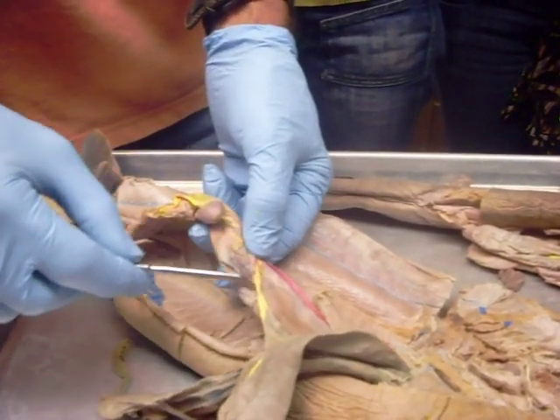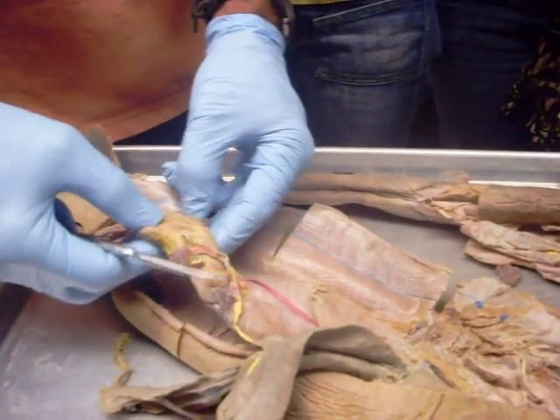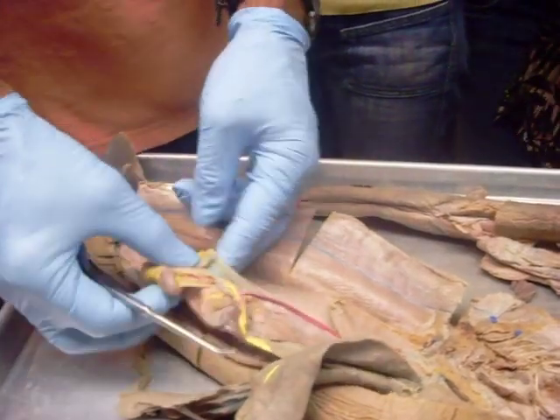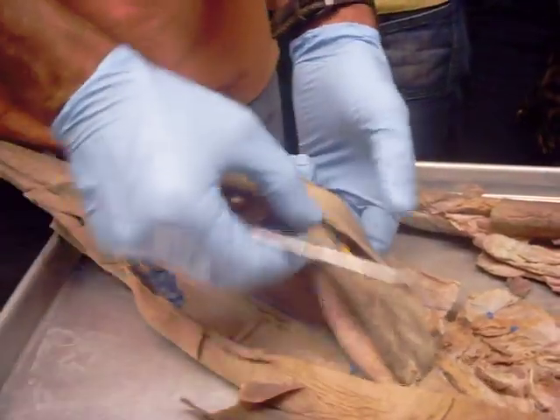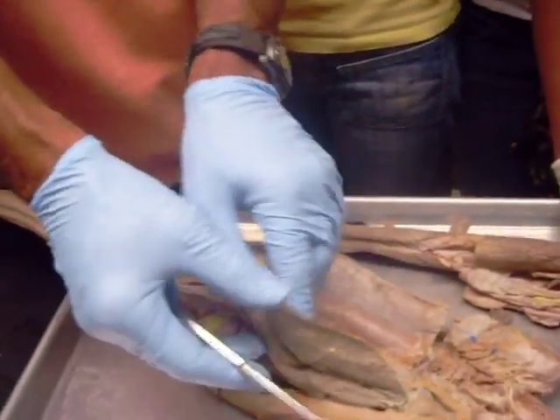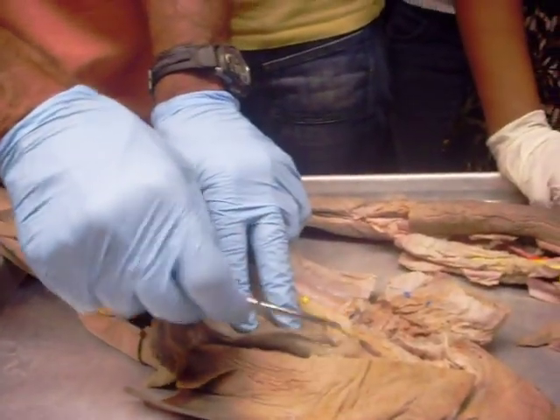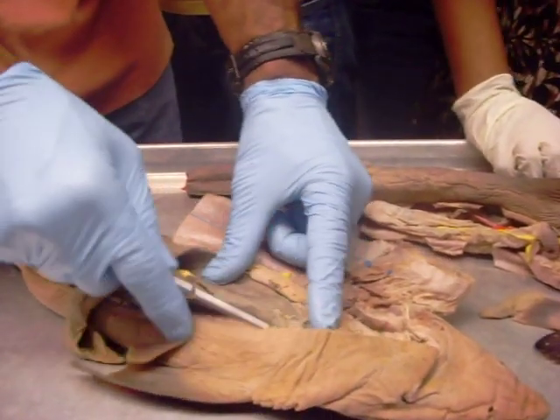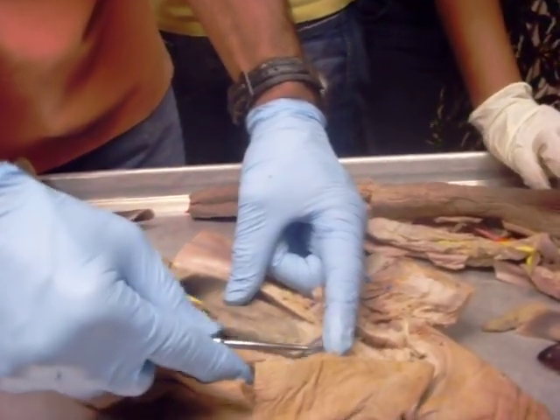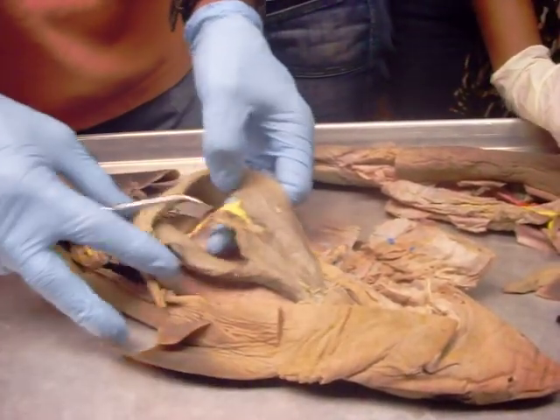This yellow in here is all hepatic portal. Everything that is injected yellow is part of the hepatic portal. As far as veins are concerned, even though these are injected, I'm not going to do the cardinals. This is common cardinal here, common cardinal on one side, common cardinal on the other side, then the hepatic. I'm just not going to pin those out — I've got enough blood vessels.